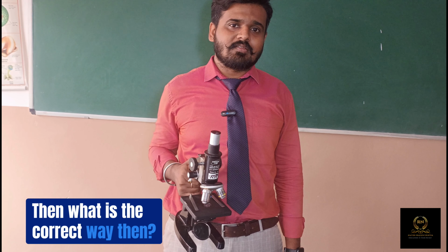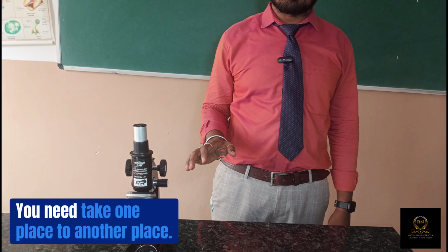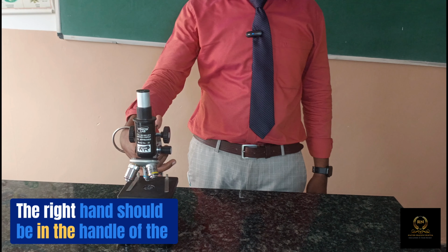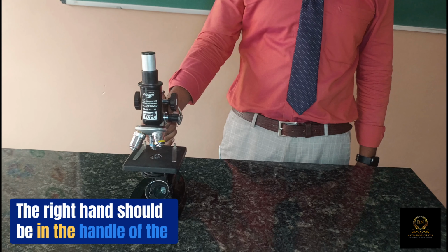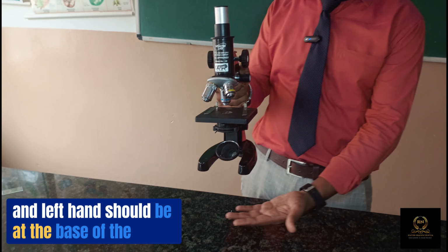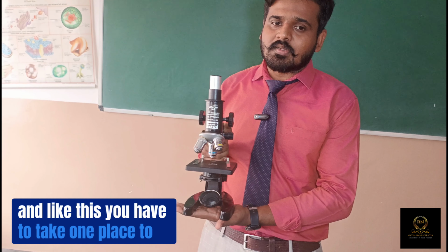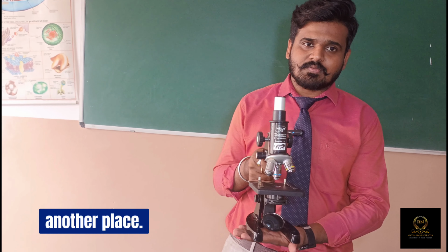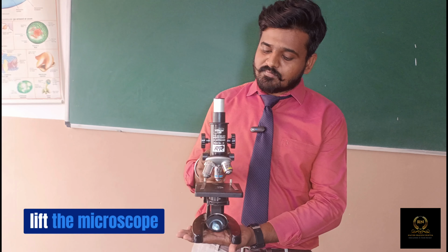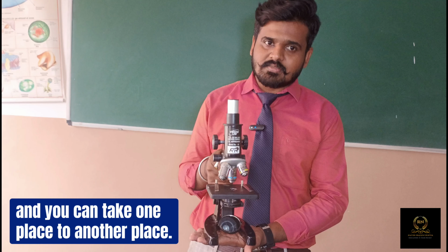Then what is the correct way? First remember, here is a microscope, and you need to take it from one place to another place. So let me explain the correct way. The right hand should be on the handle of the microscope to lift it, and the left hand should be at the base of the microscope, and like this you can take it from one place to another place. So this is the proper way to lift the microscope.